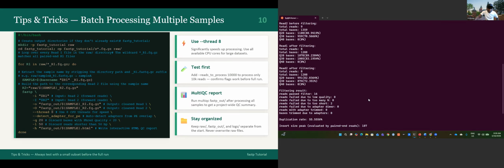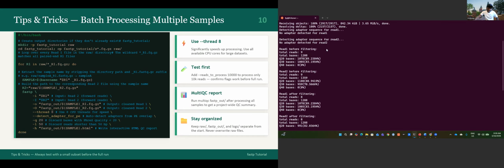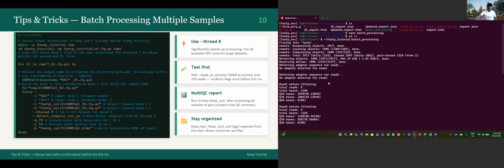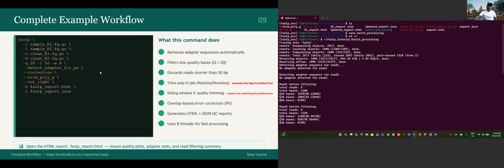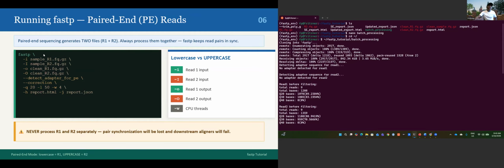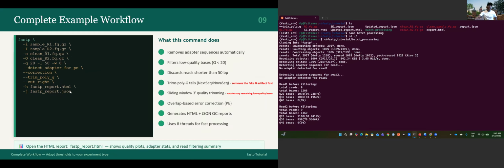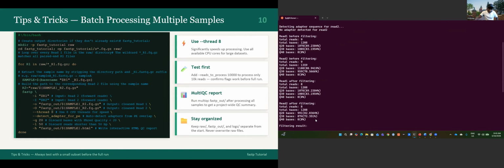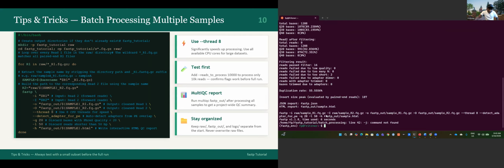Okay. Yeah, you see the same analysis. It's just the first analysis. If you want, you can update the script. I think I have it only for this part, the paired-end analysis. No, I think it's for the combined one. Yes, I didn't add the poly G trim and the cut right. If you want to update it, you can go ahead and update it. And you can see it worked. That means everything was created.